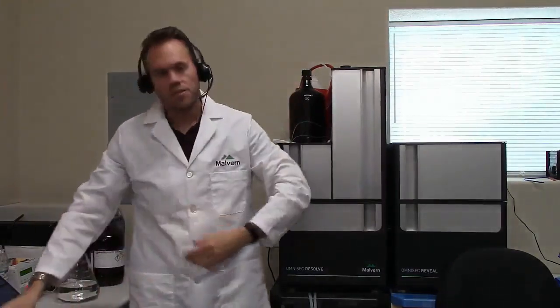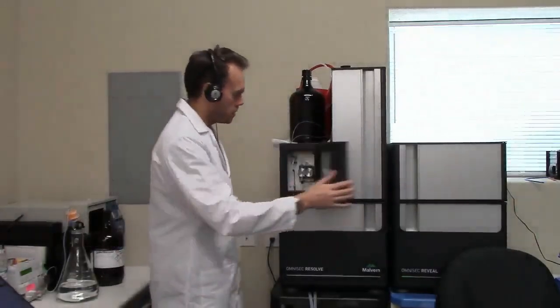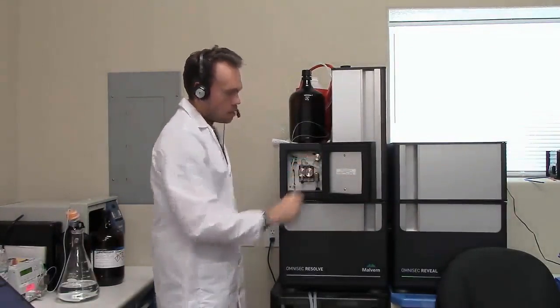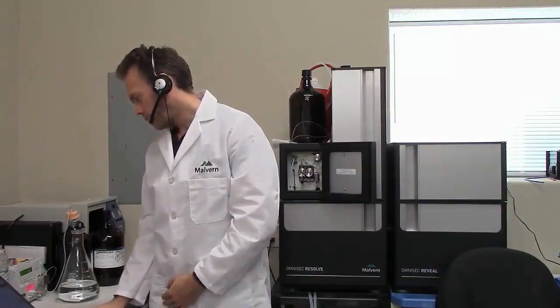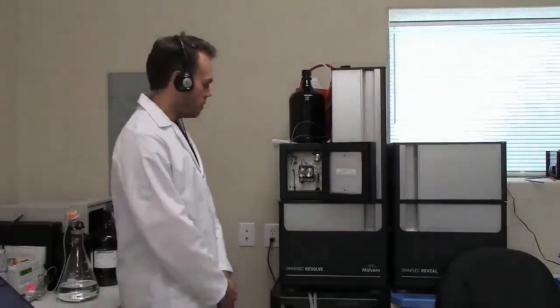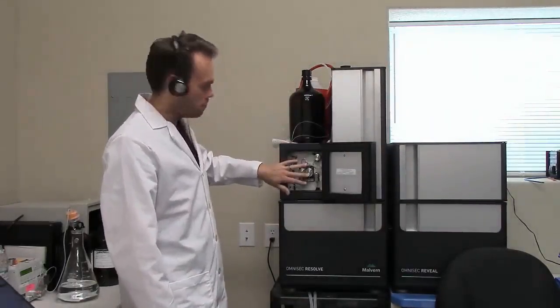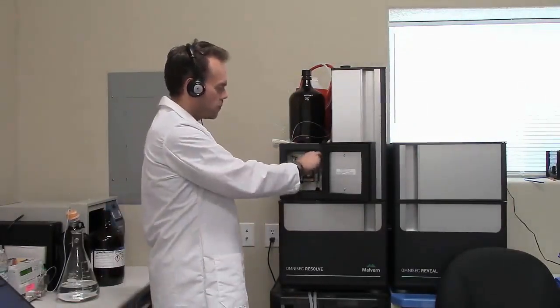Okay, so that's a new bottle of THF in place, and now we run through the same process. Open the purge valve and prime the pump for 2 minutes. Right, now we've primed the pump with THF. Again, we've flushed out the lines, the degasser, and the main pump. So we're going to close the purge valve.